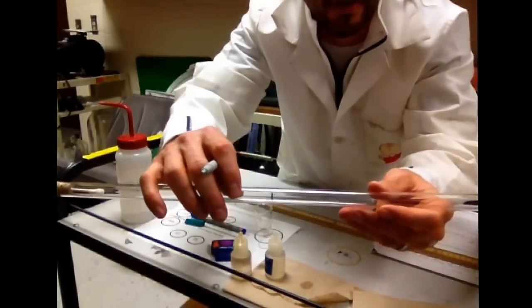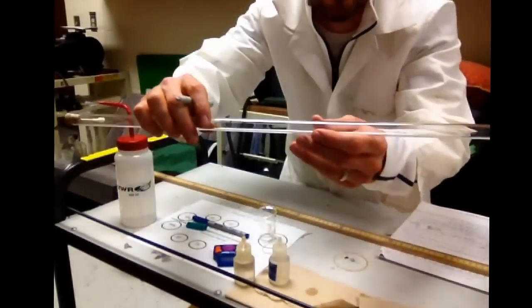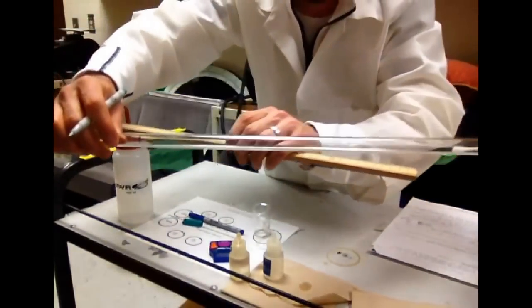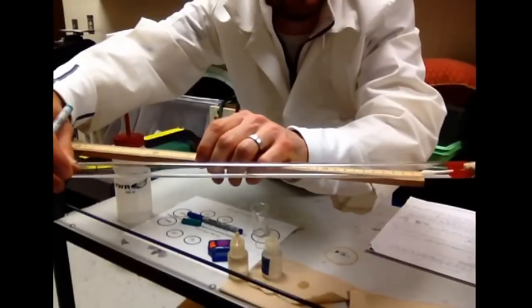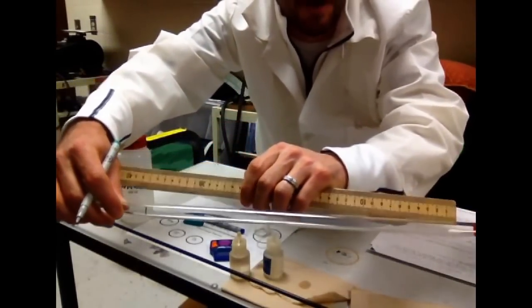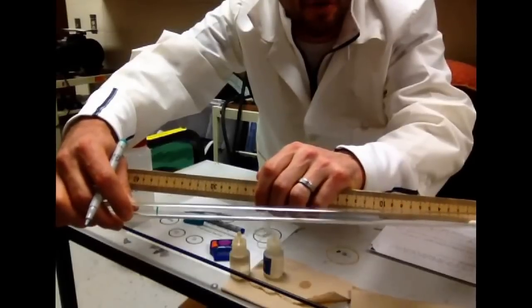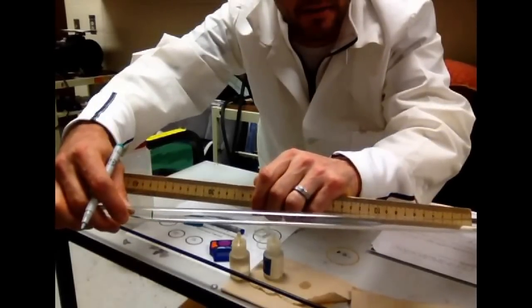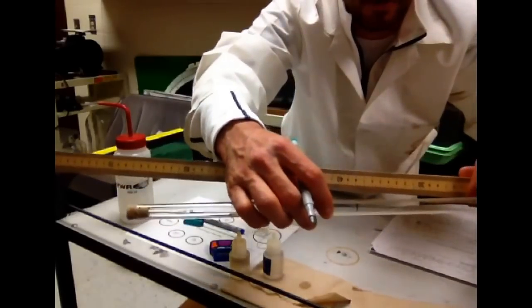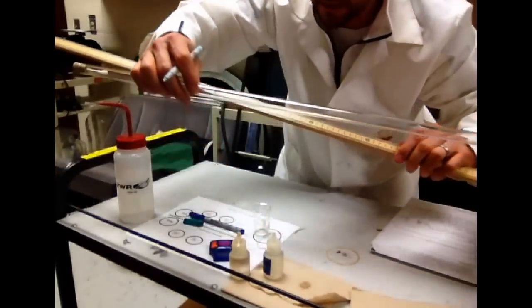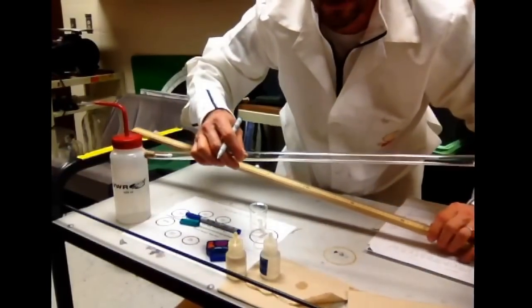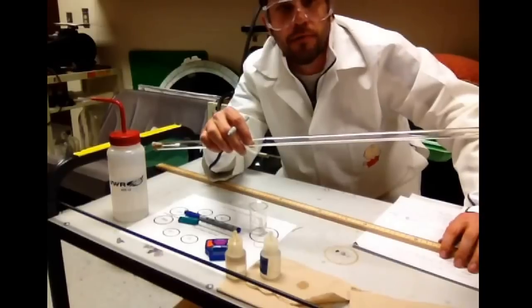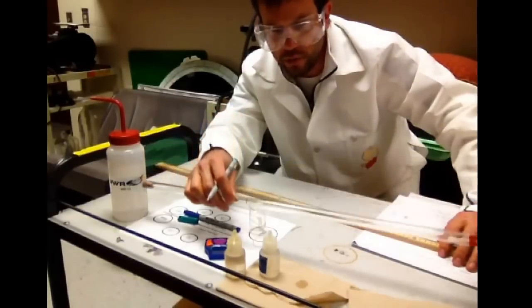It's a little tough on the iPad here for you to see. But bottom line is then I would take my meter stick and measure from the Q-tip's edge to where I made my mark and get the total distance traveled by the hydrochloric acid and get the total distance traveled by the ammonia and then basically see who was faster and then we'll take a look at Graham's law of effusion and figure out if it's what we expected.